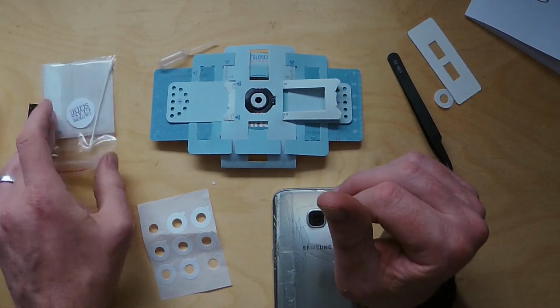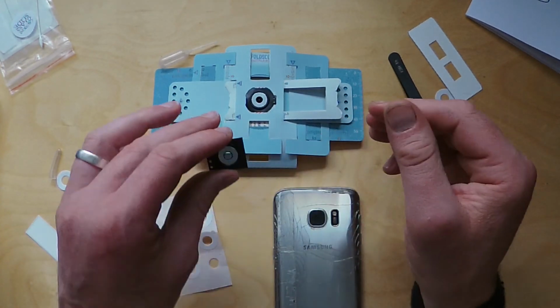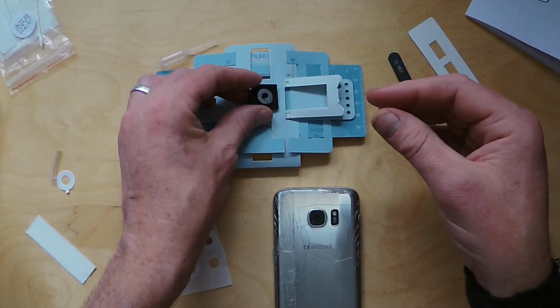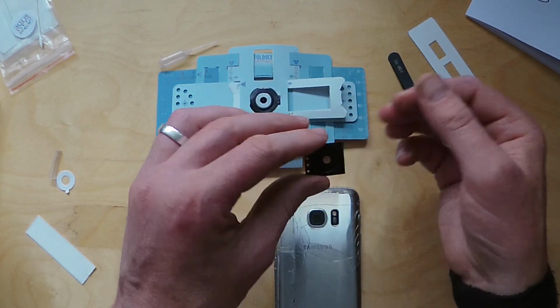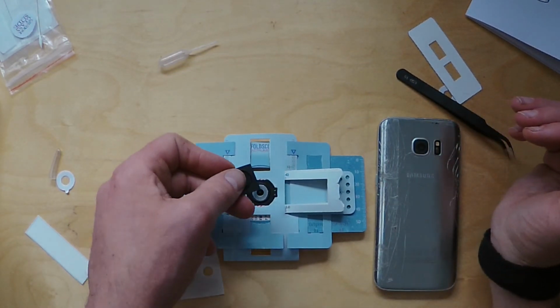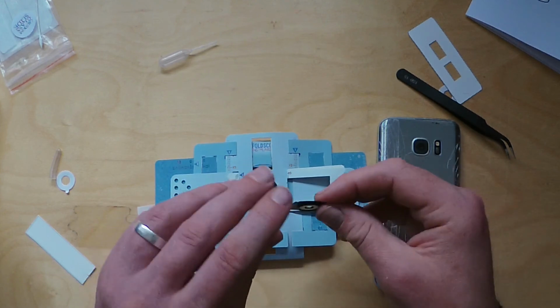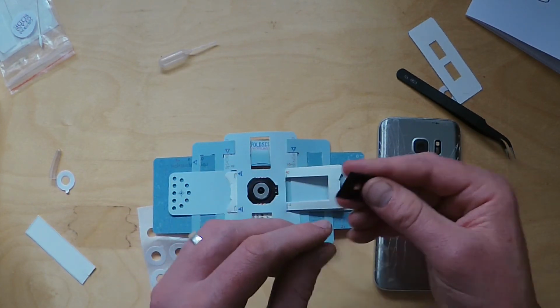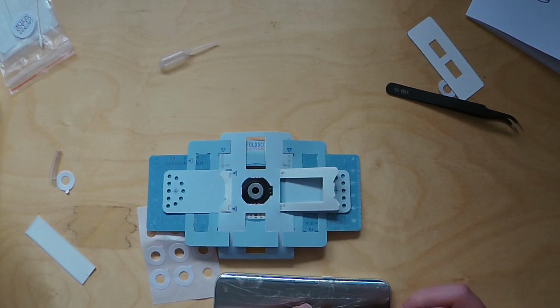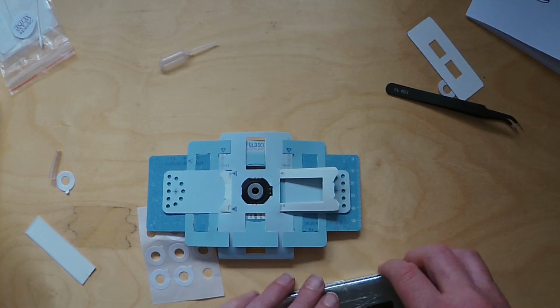And what you want to do is take your remaining lens coupler. You've used two, there's one spare, and this is what this is for. What you want is silver side down on the phone. The way to check it is have your Foldscope there and see where the magnetism is. So, right, the black is magnetized to the silver of the lens there. So what you want is the black up on your phone. And again, try and place that as centrally as you can over the lens and let that stick.